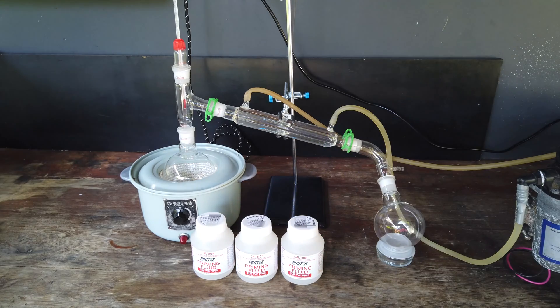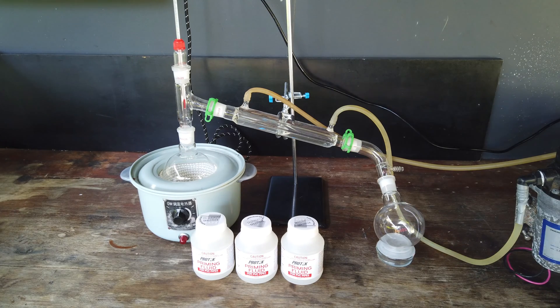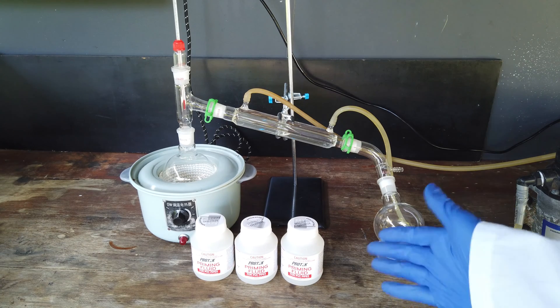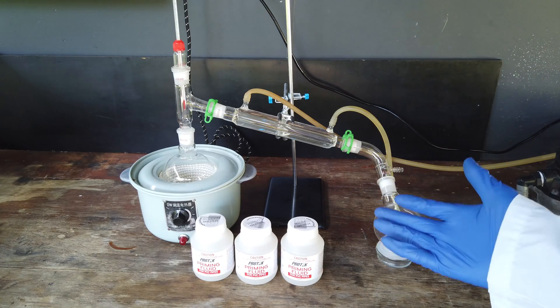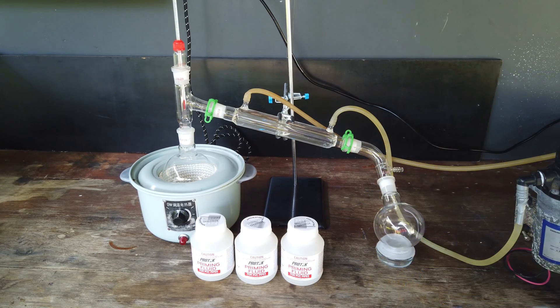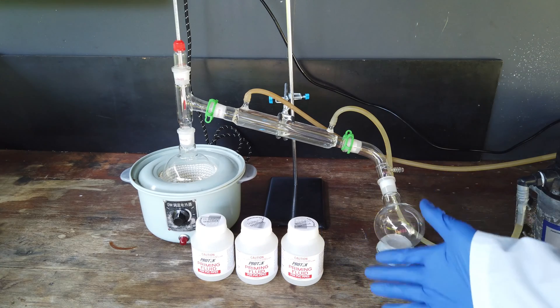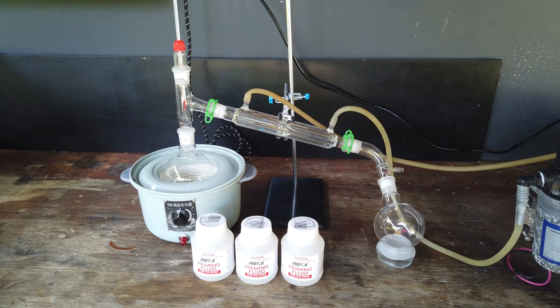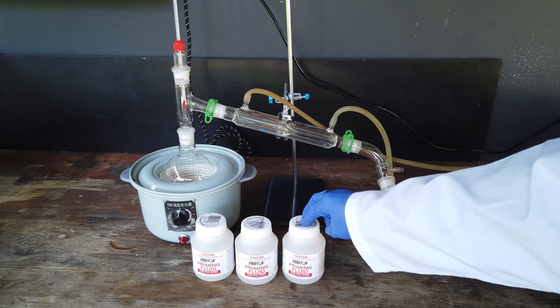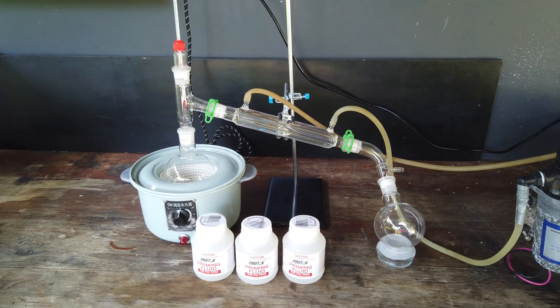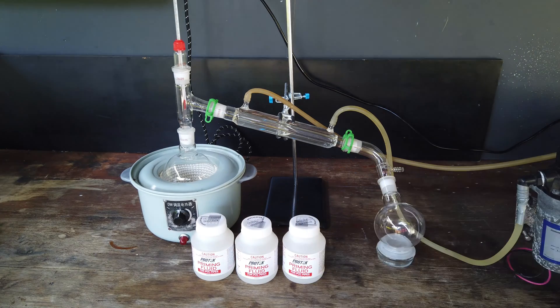Really, the only way we can try to do that is by distillation. You've probably noticed the distillation setup I've got ready here. We're going to distill our methyl ethyl ketone. If we wanted to really purify it, fractional distillation would be best. But as I said earlier, I really don't need super high purity. All I really want to do is get rid of any super volatile components and any super low volatility components that are often present in products you use with PVC.